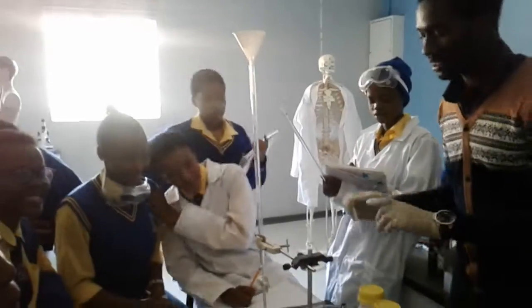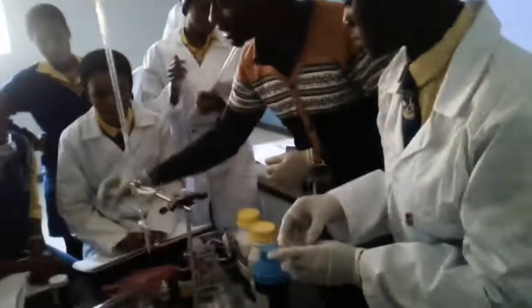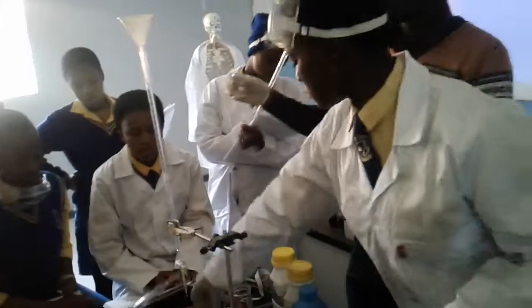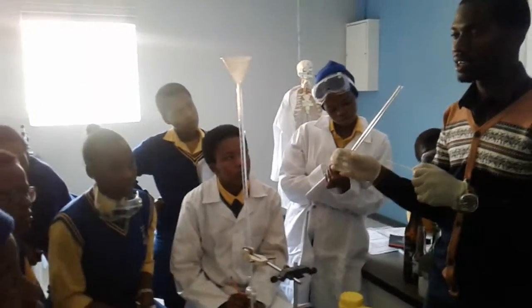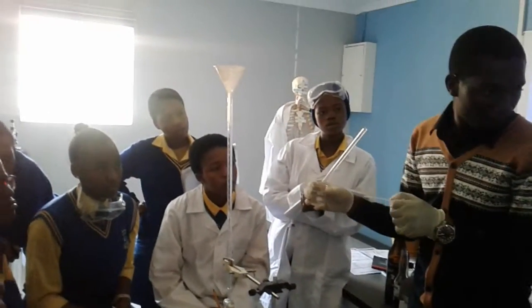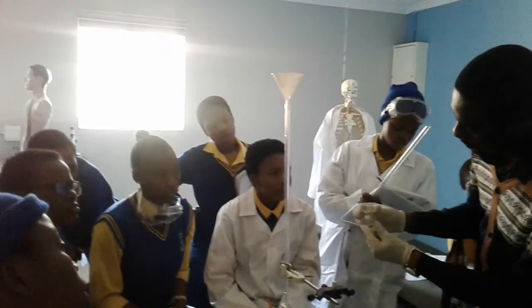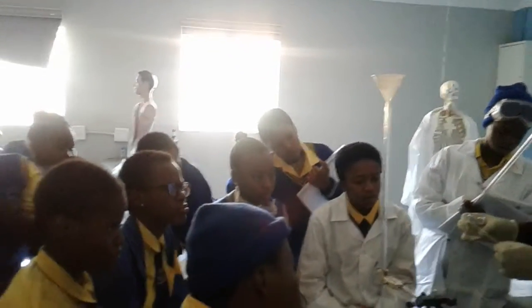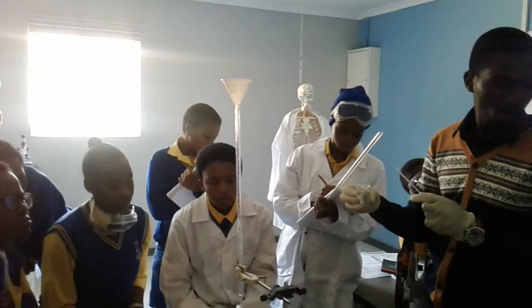Alright, and then what you do then, you're gonna use stoichiometry to measure the concentration here. So how can you get the concentration here? C is equal to n over V. How do you get n? m over M. So you measure the mass and then the volume is given. Okay. So you just check what's the volume. You measure it. Me, I'm not doing the action. I'm showing you how to do it.